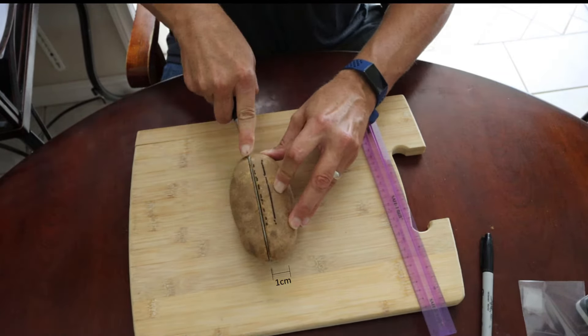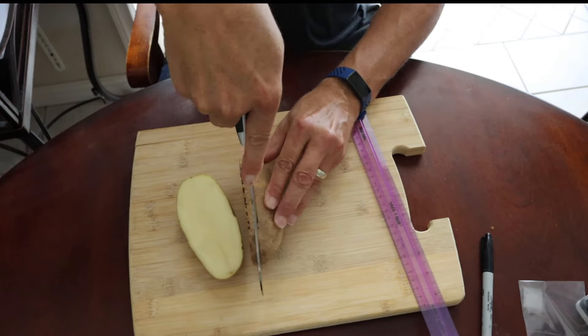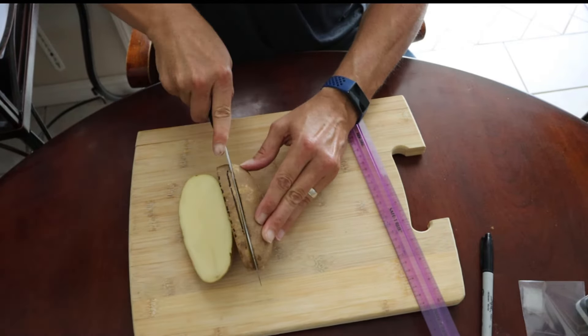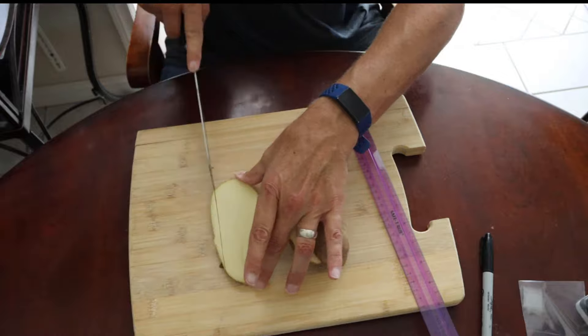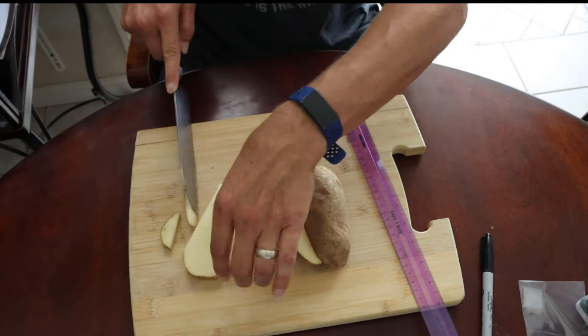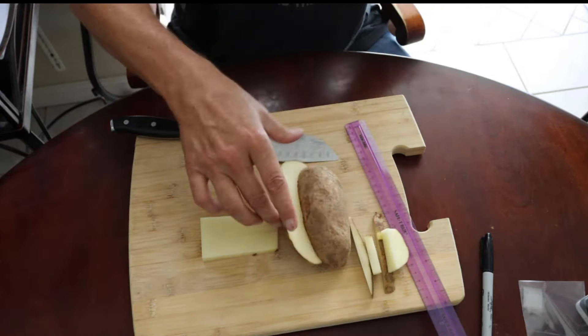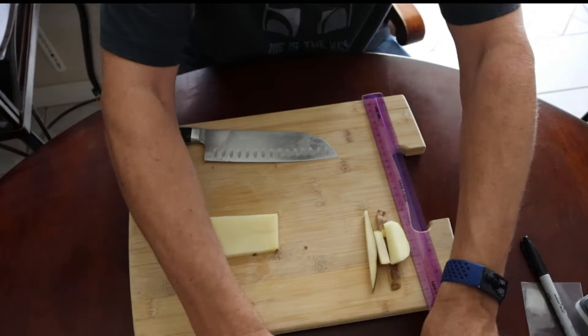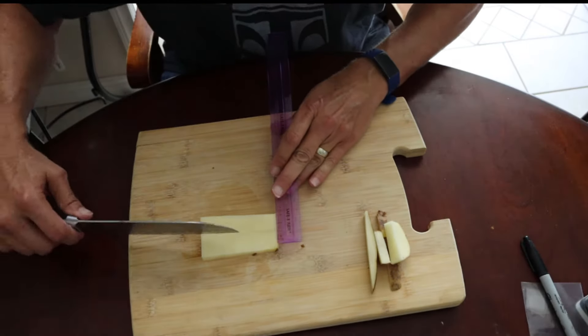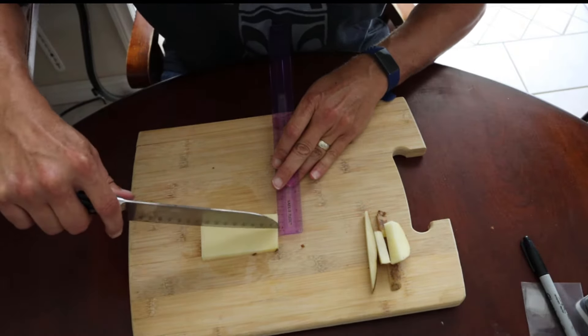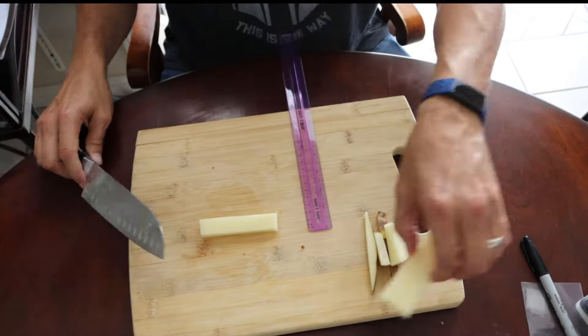Now in this video I'm recording at high speed just to remind you of the process of what we did. So be very careful if you're redoing this experiment or doing it for the first time. I'm nowhere near using the knife at the speed that it appears because I'm just giving you a summary.